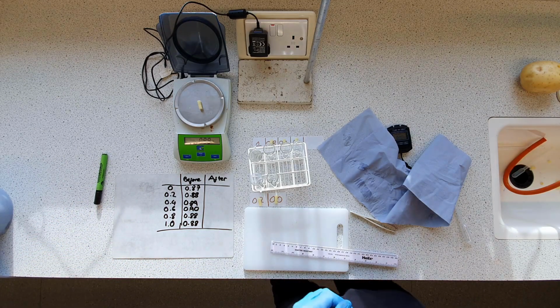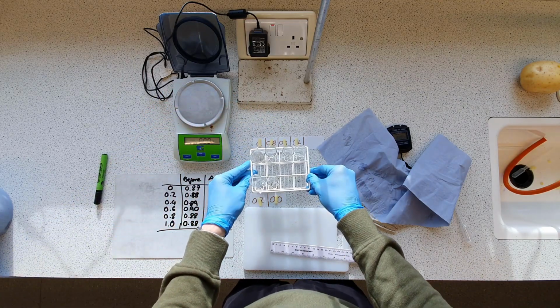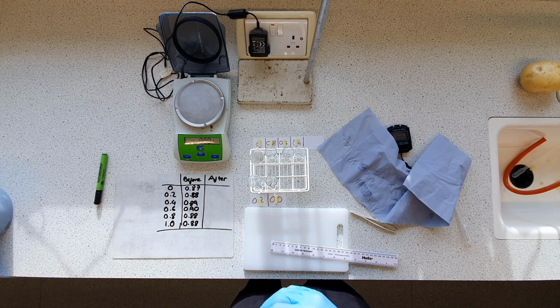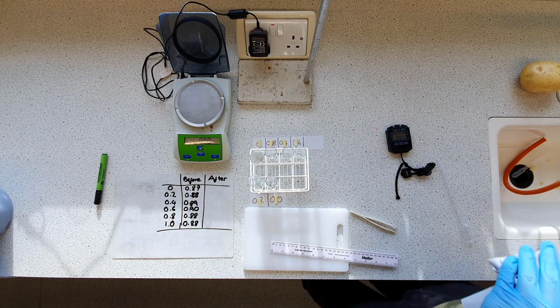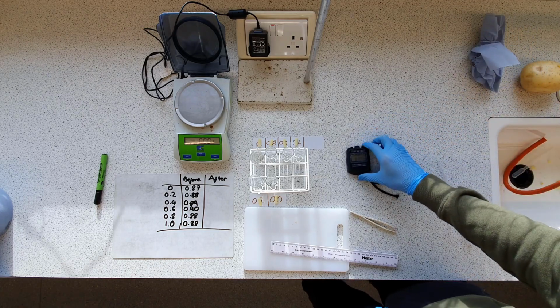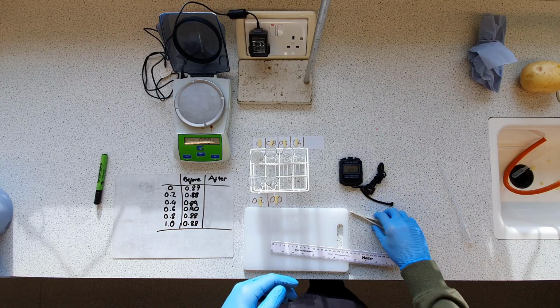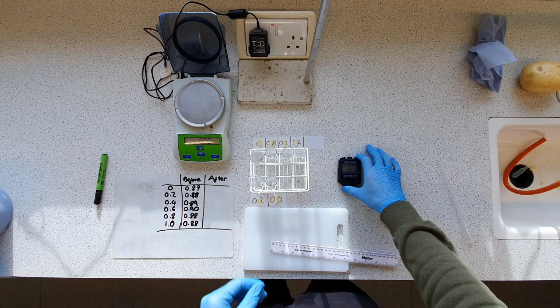I'm impressed with myself. Right, so what I'm going to do now is place them, straighten up a bit, in their respective boiling tubes, and I'm going to leave for 20 minutes. Now I'm not going to make you watch for 20 minutes, so I might cut to another shot in a second, but I'll be leaving this stopwatch running. There will be a few seconds difference between each thing, but it won't make much difference, I promise you. And we will see what the results are.